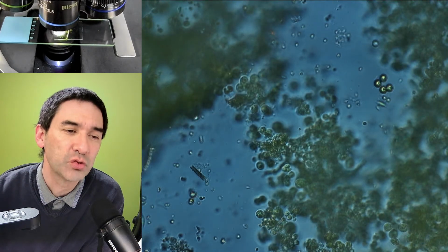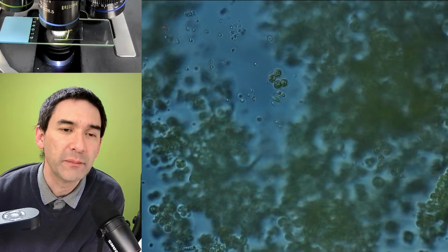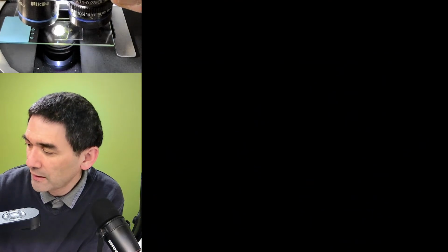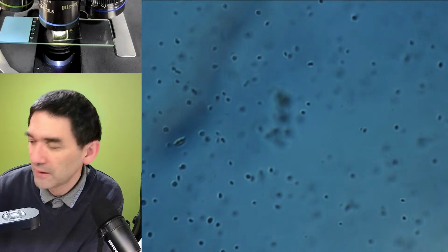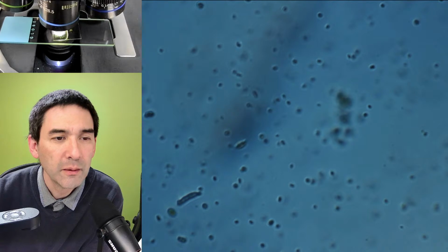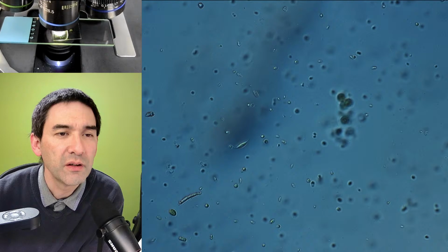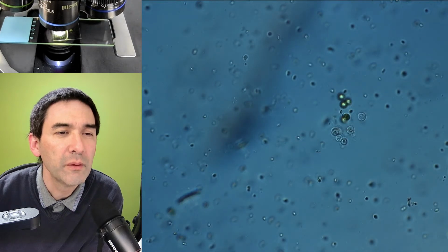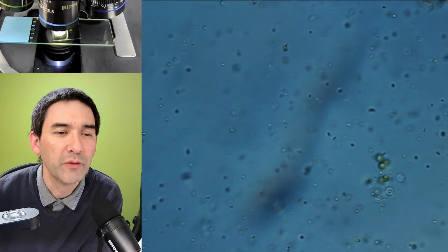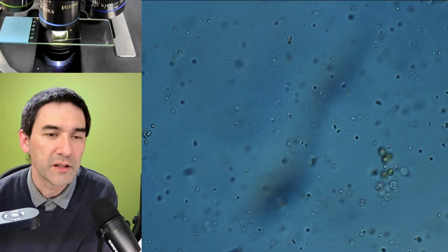Generally, it's rarely just one type of species that you find, but usually there is always some kind of a dominant one, right? So I just want to show. Let's go up. No, I cannot go higher, because I'm bumping. But if you actually look here, you might see that some of the cells here, there's something moving up. At least in the center, something is moving. Yeah, not a lot. Usually there is indeed one kind of dominant species.